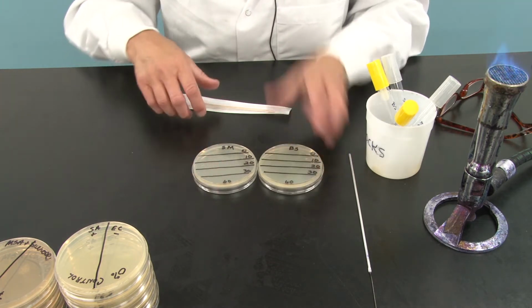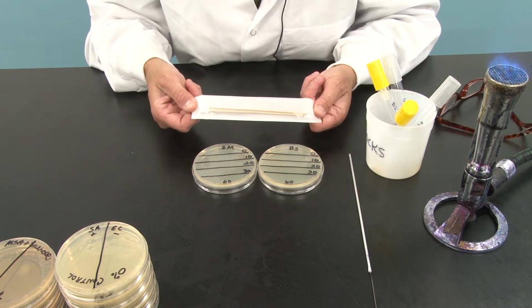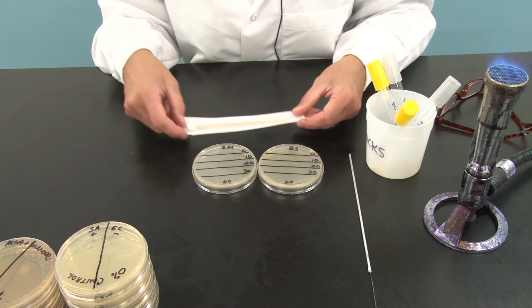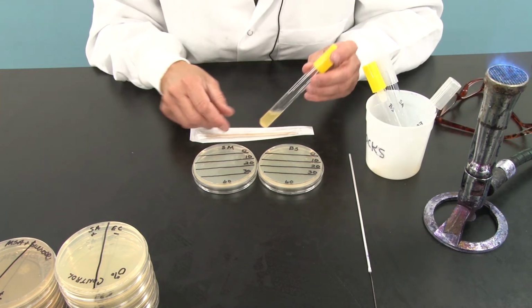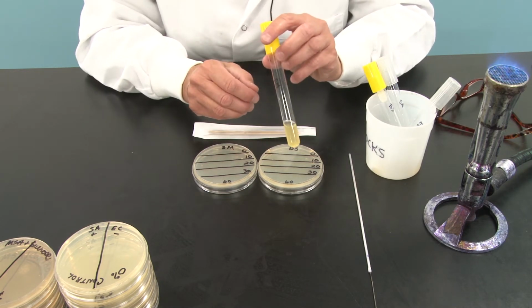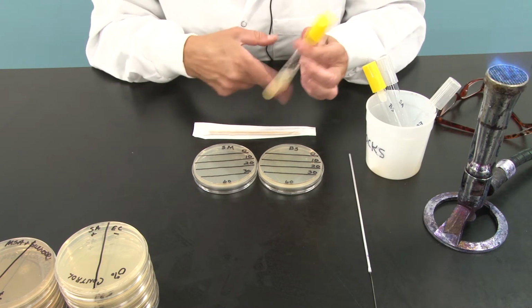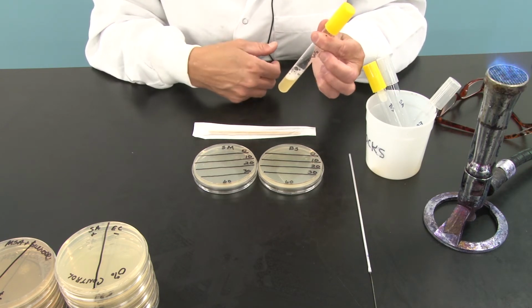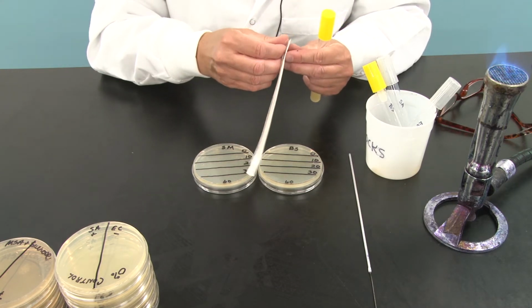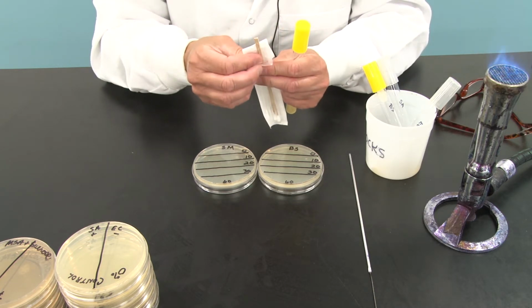And to do this, we need to use something called sterile swabs. You guys know these in healthcare. They use them all the time. So right now they're sterile and they're wrapped. I have a broth culture here of Serratia marcescens, and you can see it's labeled SM. So I'm just going to hand vortex that to mix it up. And I am going to open up my sterile swabs. They come 2 in a pack, so I'm going to open them at the handle end, not the swab end.